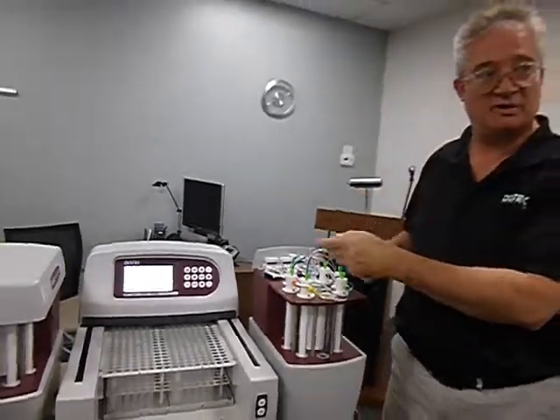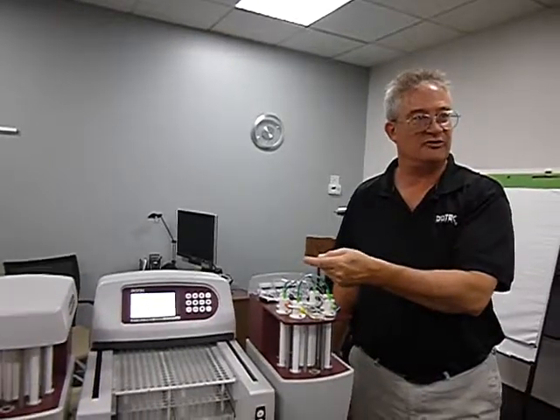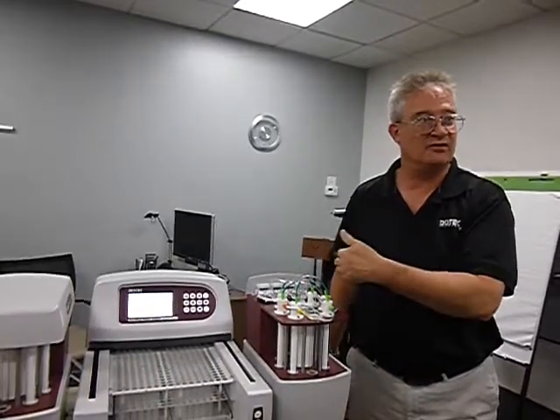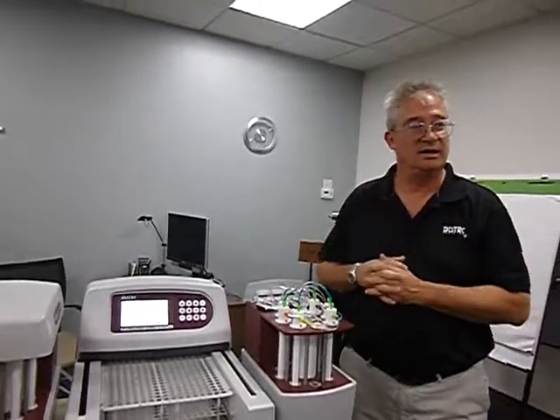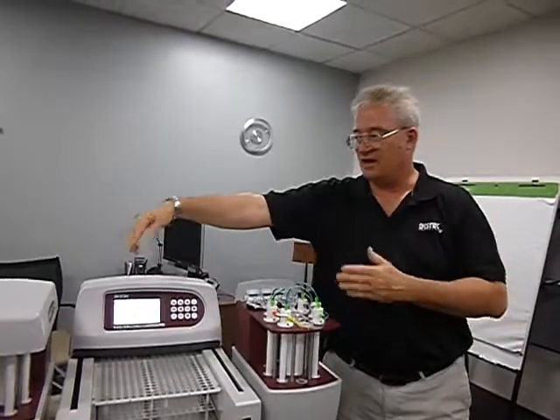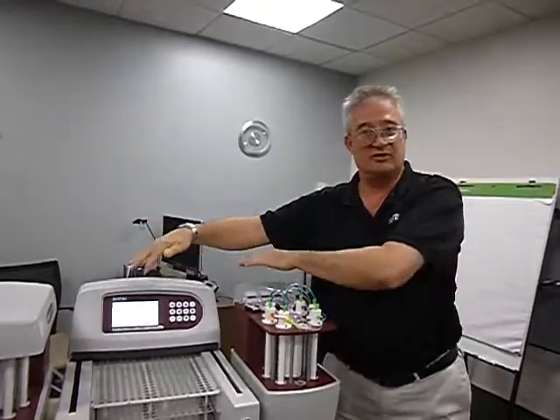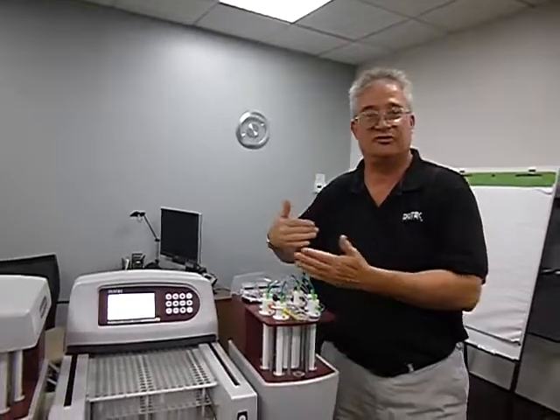It's going to wait, and what you're just going to have to do is every couple of minutes go back and try to start it, and then it will start. If it knows there's going to be no time conflict, then it will start running. But it won't allow you, if it senses at any time that run is going to interfere with the head movement of this side, because it wants them both to work, so it's just going to wait.